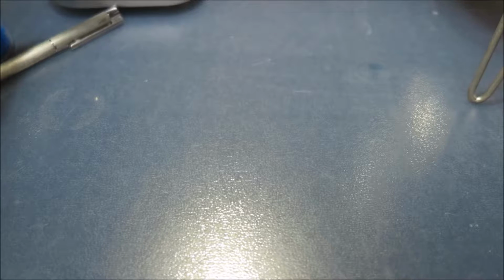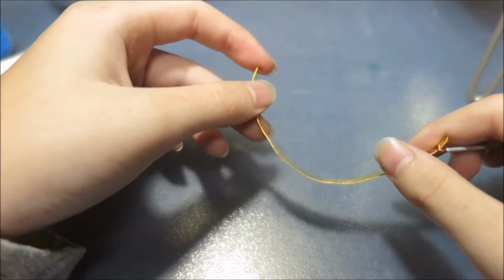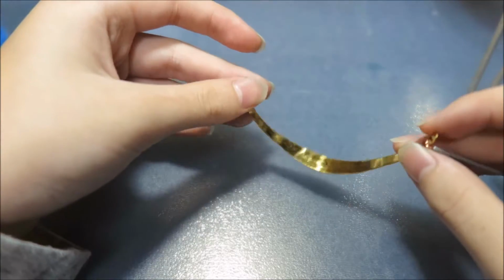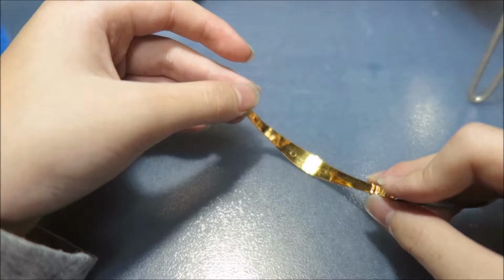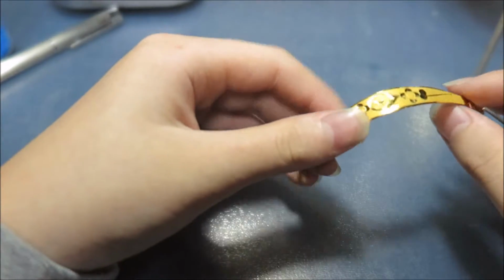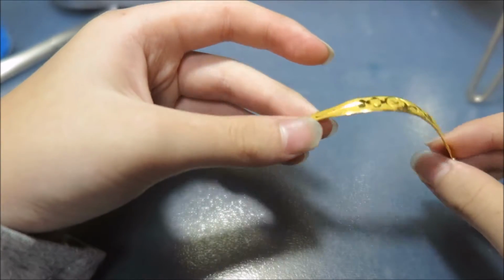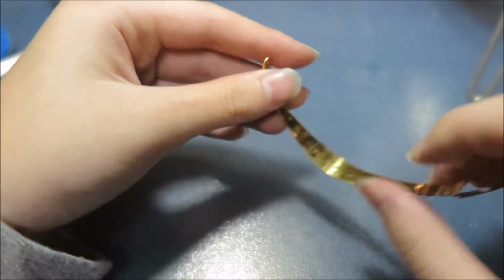this experiment. So I'm going to use something that is not very reactive with other elements, and that is, my friends, pure gold. So this is a pure gold bracelet I got from my, I don't know, first birthday or something. And no harm will come to the gold, otherwise my mother will kill me. Yes. So this is pure gold, and you can see that this looks like some kind of paint over it, but it's not paint, it's just gold with a different sheen. It's not matte gold, I think, this is perfectly sheened and shiny gold.